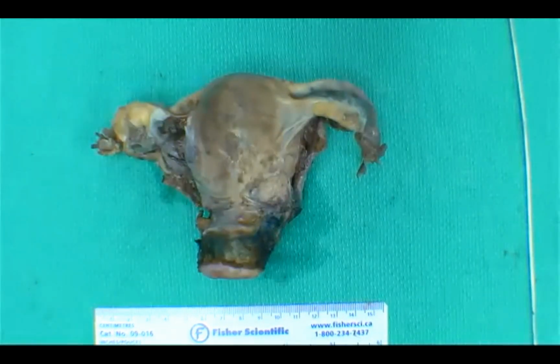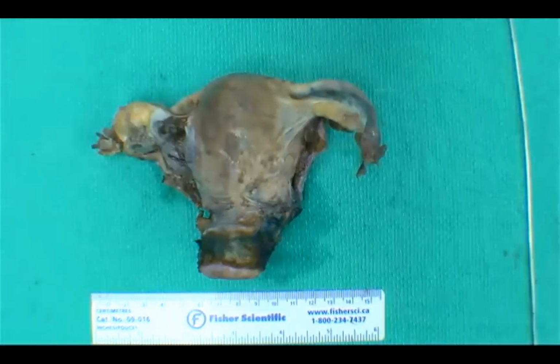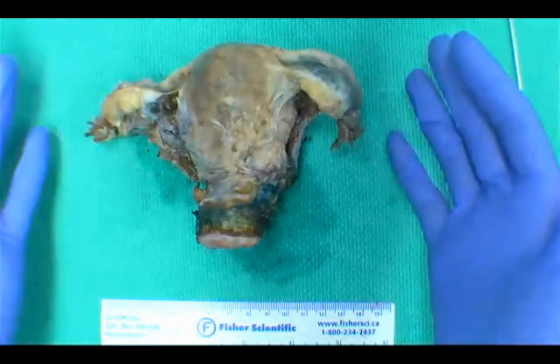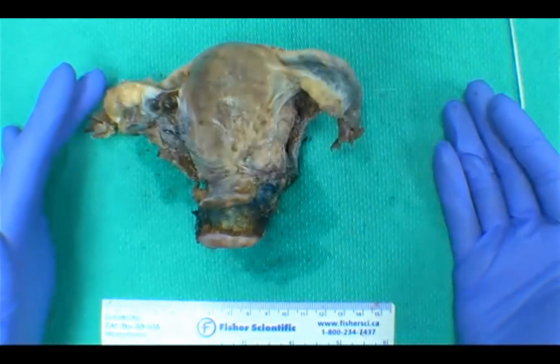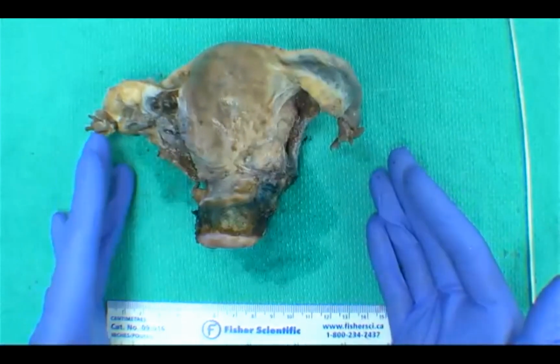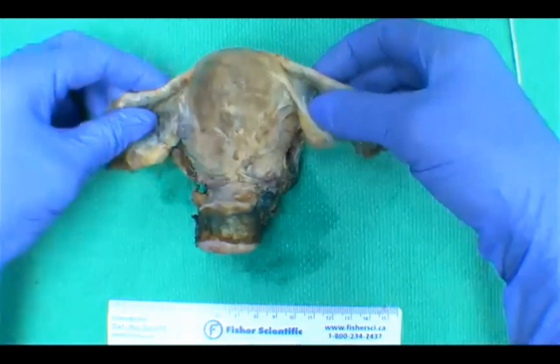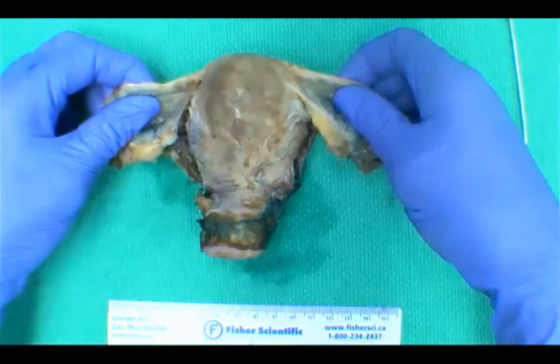Caveat again being that, check your institution SOPs. Sometimes it can be pathologist dependent too. Okay, so it is a little bit strange to be looking at this total hysterectomy without parametria, but we do have a diagram to show you what are the steps to take for grossing a radical hysterectomy for cervical cancer.